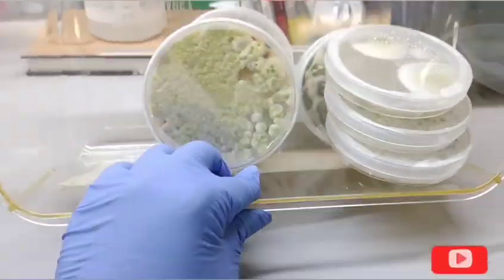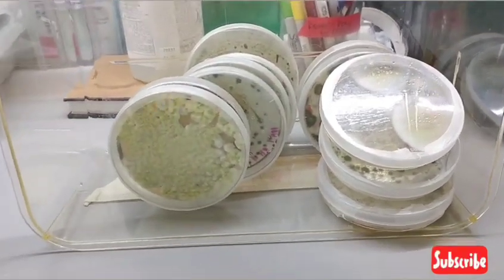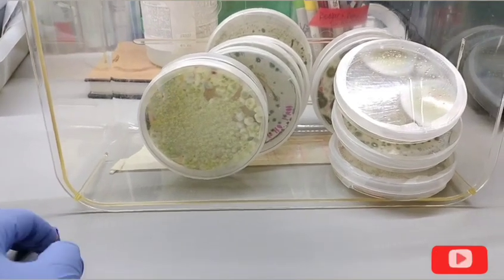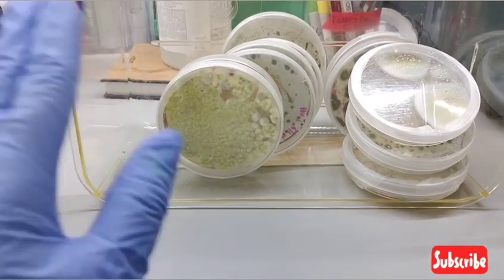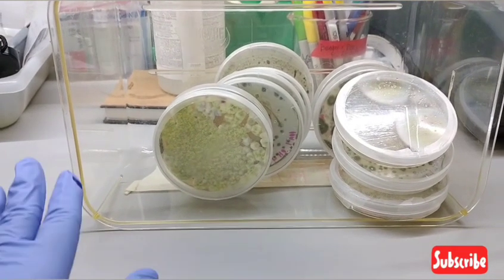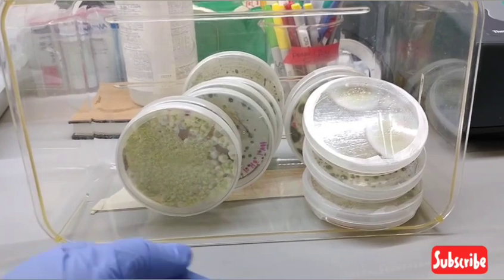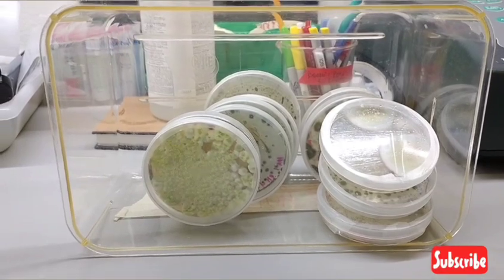I'm starting a new project soon. It hasn't kicked off, but I like to be prepared. So I decided that, seeing that I hadn't worked with that particular pathogen before, let me go through our samples that we have and culture them out to see how they grow, right? So in a microbiology lab, you usually have your parent or the original that you only culture from once, you put it away in long-term storage, and you only go back to use it if your working cultures, the additional samples, or the children or daughters that you made from that original, got contaminated or you lose them.